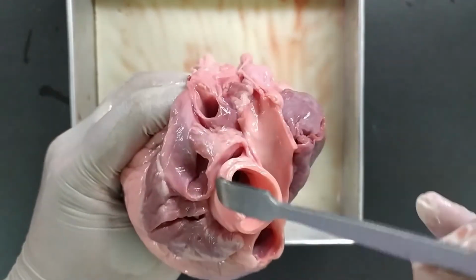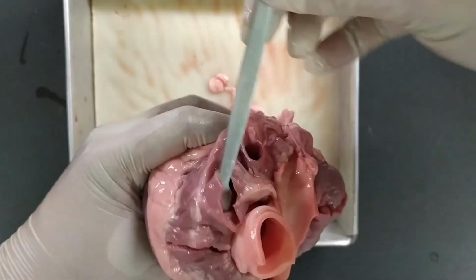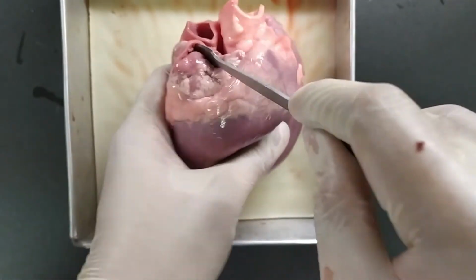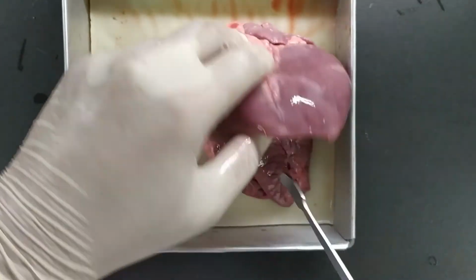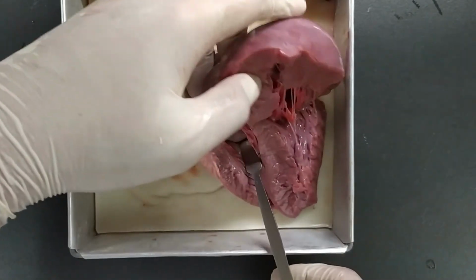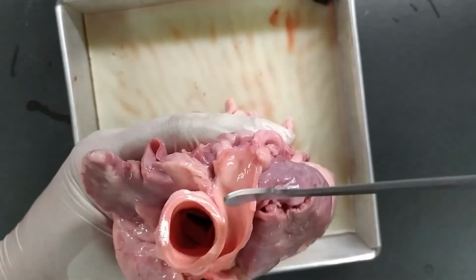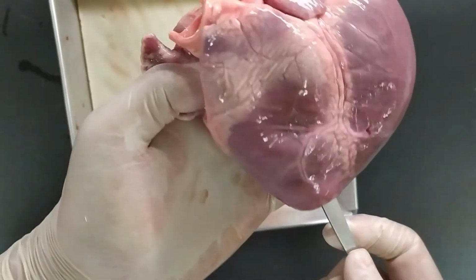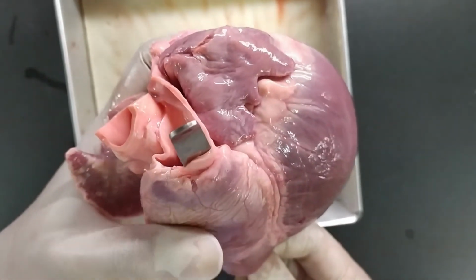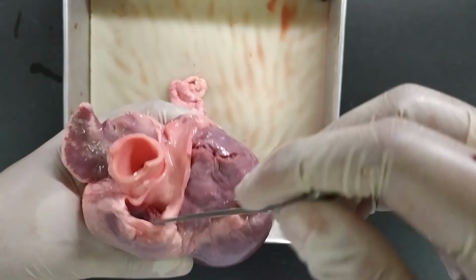First, deoxygenated blood will be collected by the superior and inferior vena cava. In this specimen, we can no longer see the superior and inferior vena cava due to damage. The blood will be temporarily stored in the right atrium until it pumps down into the right ventricle, passing through the tricuspid valve. It will then be delivered to the pulmonary artery. Using this specimen, we can see that the right ventricle is connected to the pulmonary artery through the pulmonary valve. The blood will move out from the right ventricle to the pulmonary artery going to the lungs.